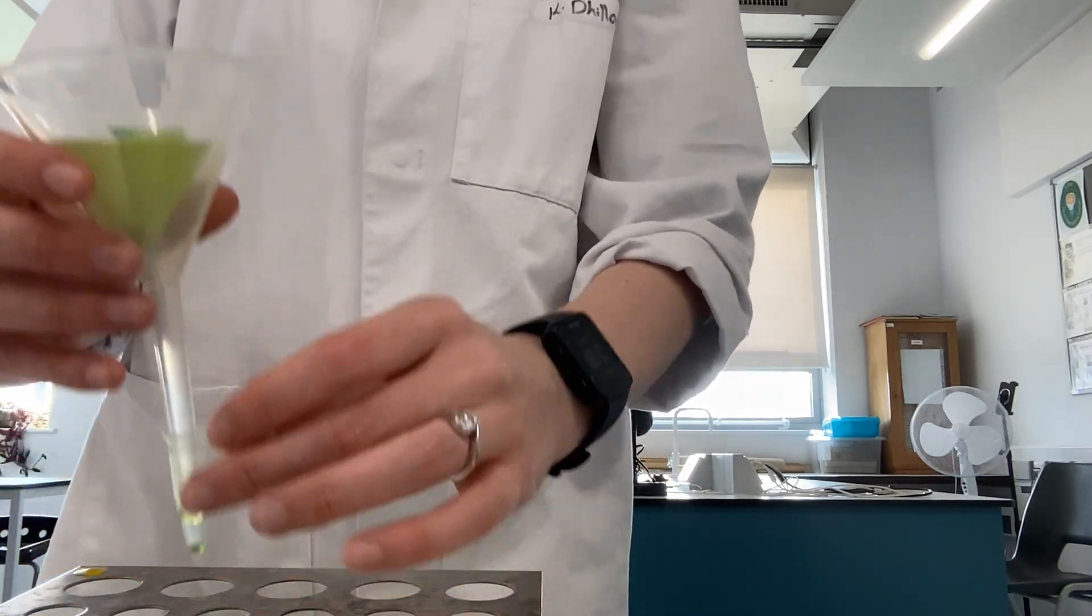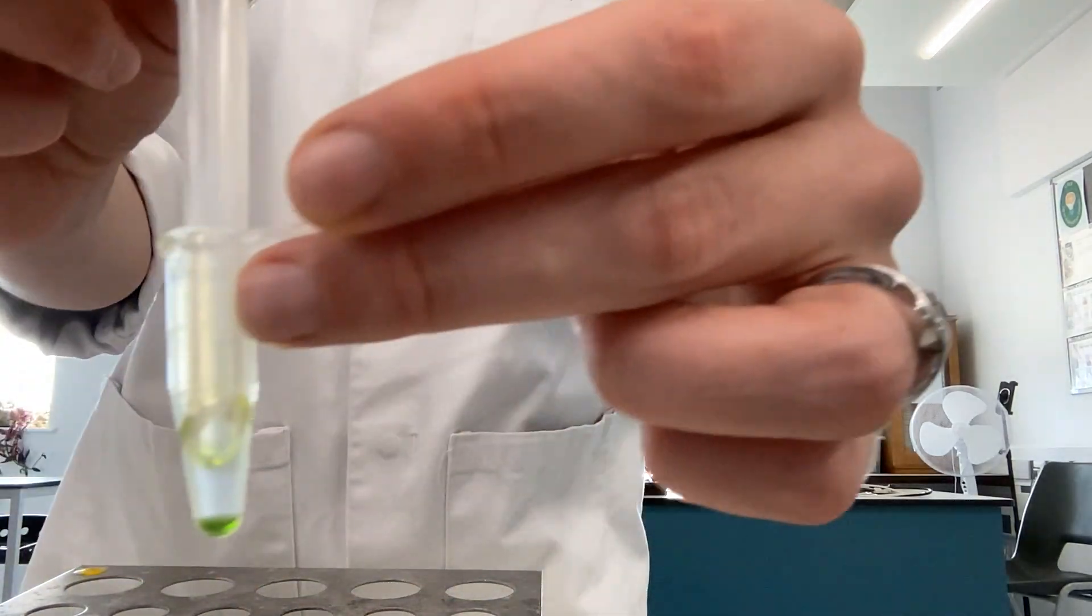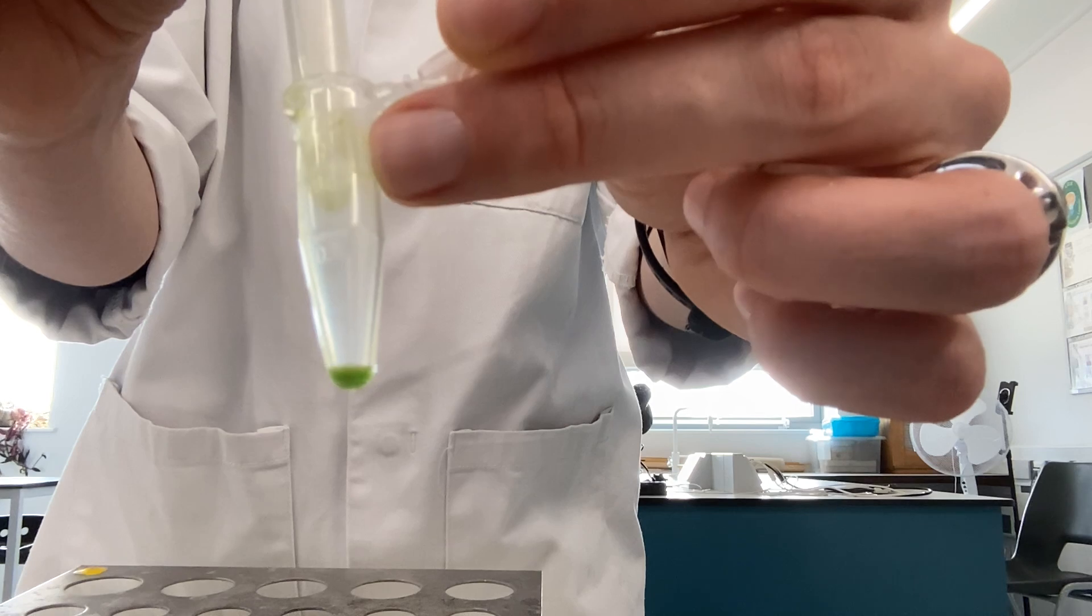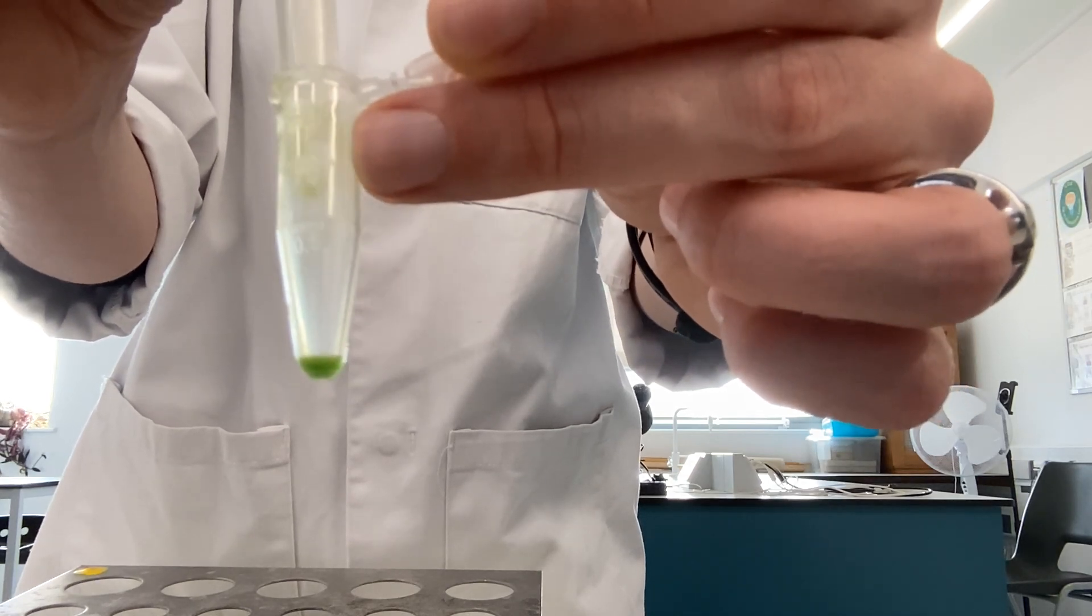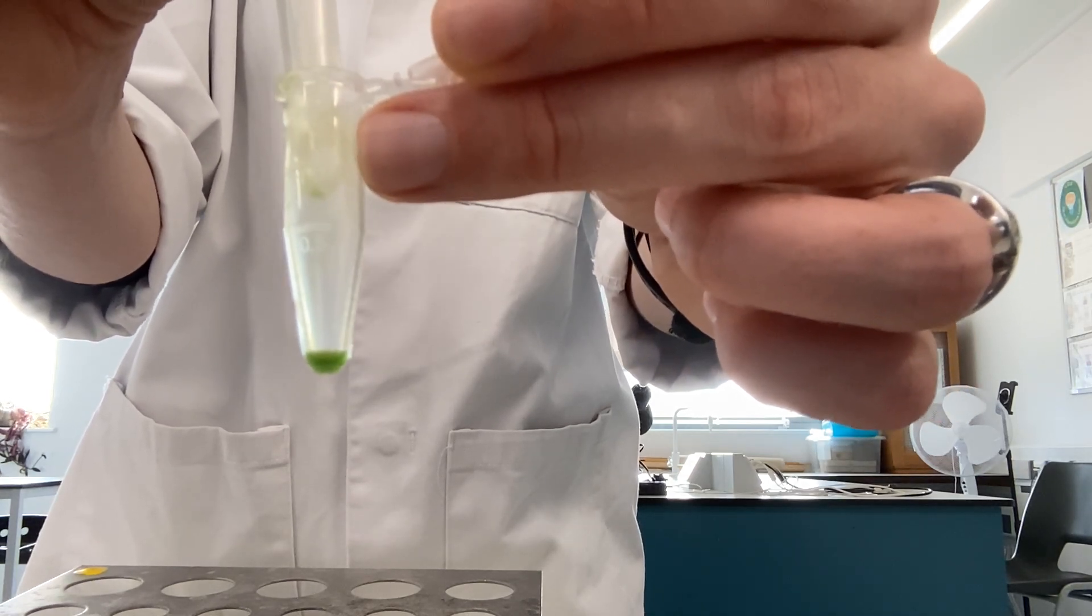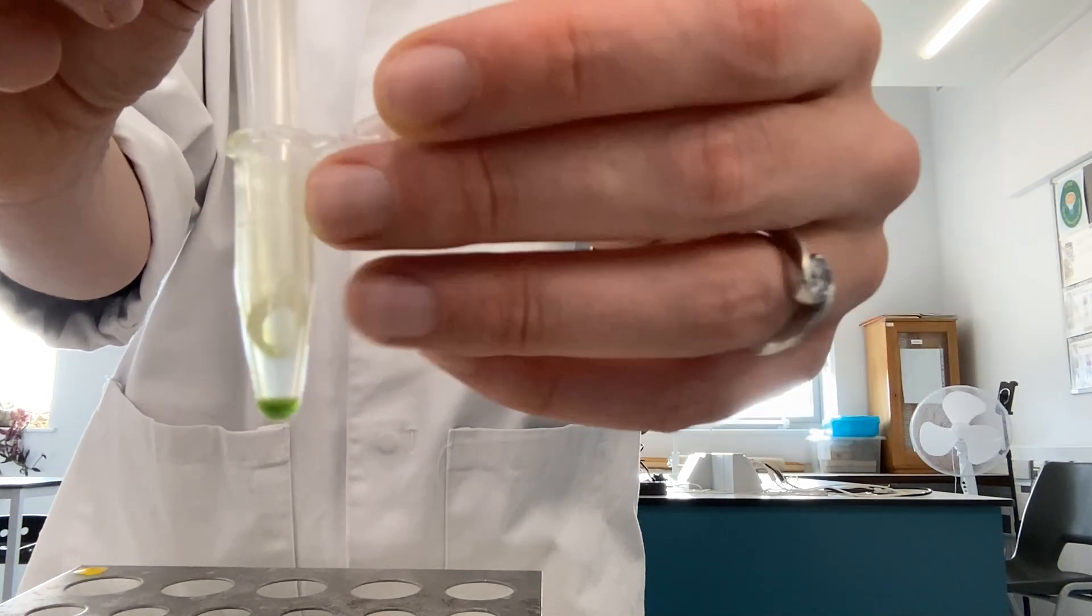This is now filtered through, and you can see that we have collected a small bit of liquid at the bottom there. We don't need a huge amount because we'll only be putting a very small drop onto our TLC plate.